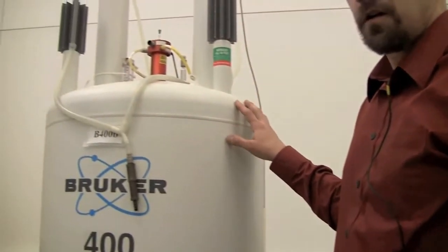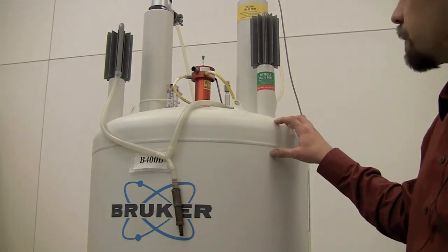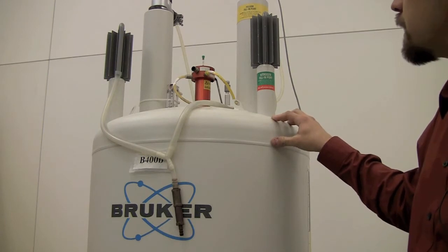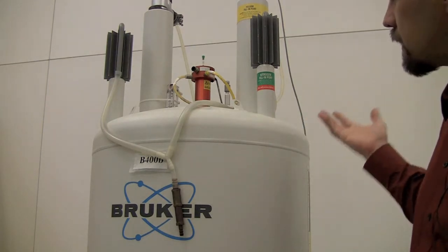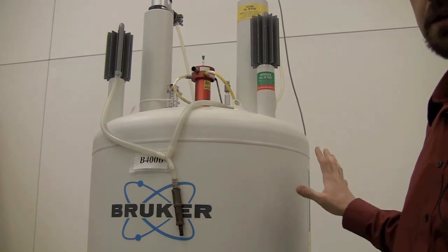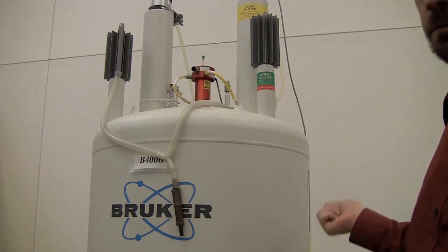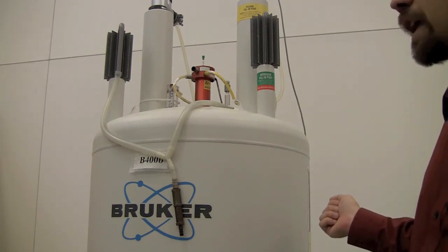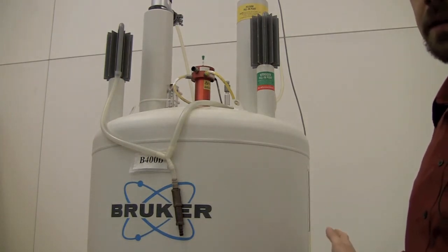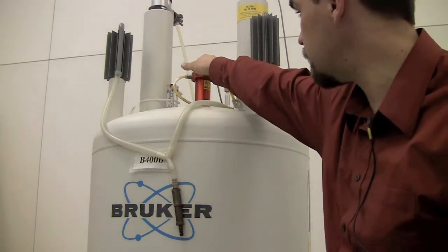One rule we have on all the walk-up instruments is that we always keep a dummy sample inside of the magnet. The purpose for this is to make sure that we don't try to put two samples in the magnet. So that means that when you click eject, if nothing pops up, don't assume that the instrument is empty. Assume that there's a sample stuck down inside the magnet. A bad thing that you could do is to drop another sample in on top of a sample that's already in there. It could break, make a mess, and be no good. In this case, the sample popped up, so that's good.